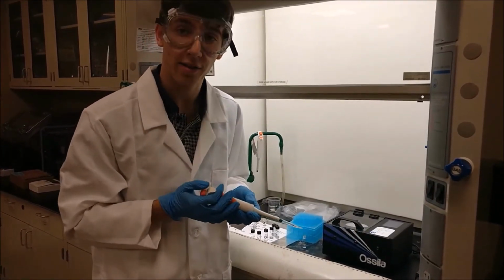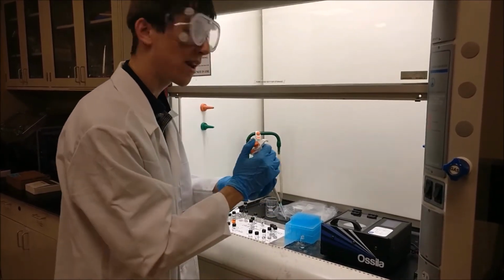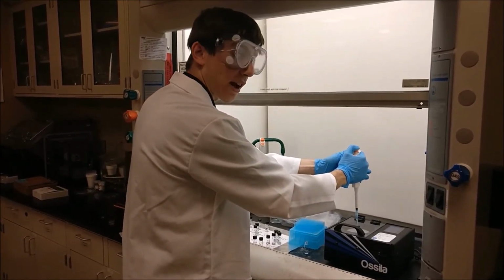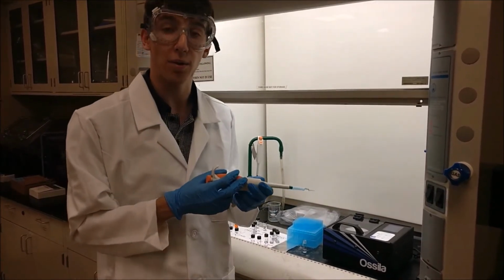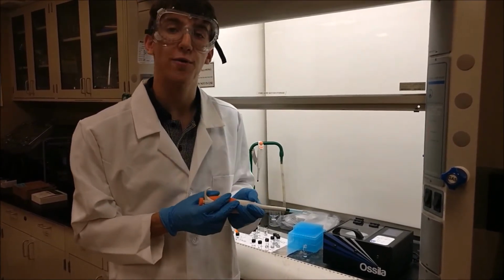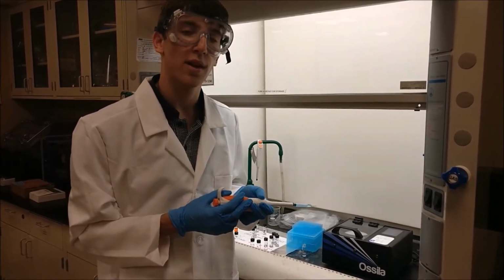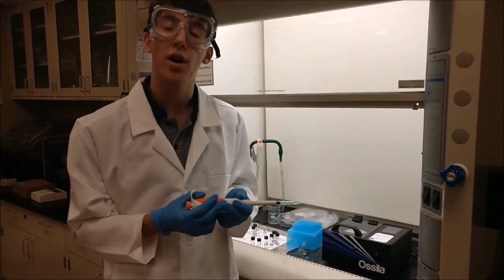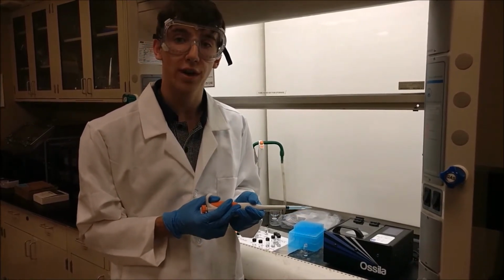I'm going to wait 10 seconds for the speed to ramp up to the maximum speed of 1,500 rotations per minute. Then I have 5 seconds to deposit our solution, taking care to only push the pipette down to the first stop. This is done to ensure that no air bubbles get onto our substrate and mess with the uniformity of our film. Now I wait 40 seconds for our solution to continue spinning onto our substrate. After these 40 seconds are up, we will carefully take our sample and put it under vacuum in a desiccator overnight to minimize our impurities in the film.